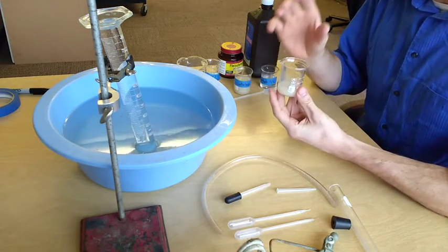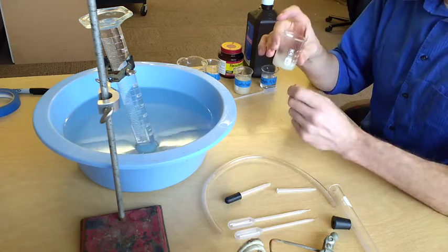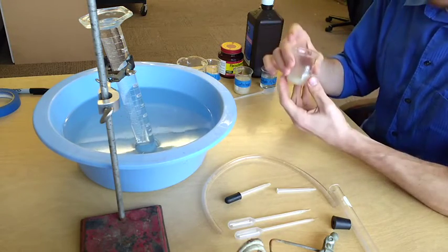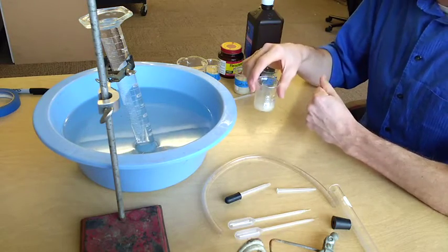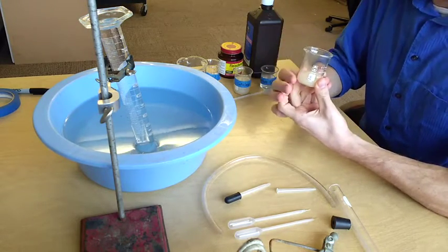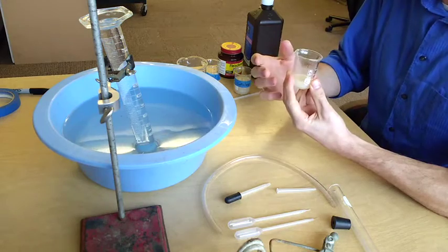If I were to measure temperature, I want to adjust the temperature of this catalase. So I would then put this container either in cold water, an ice water bath, or a hot water bath to change the temperature of this enzyme before we started our experiment.